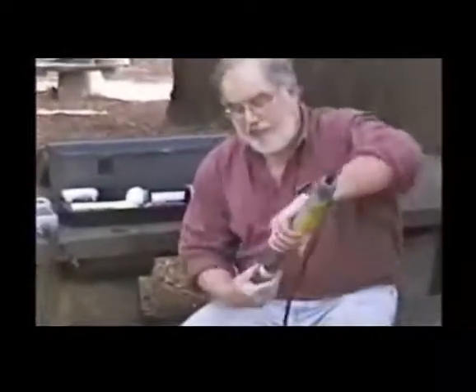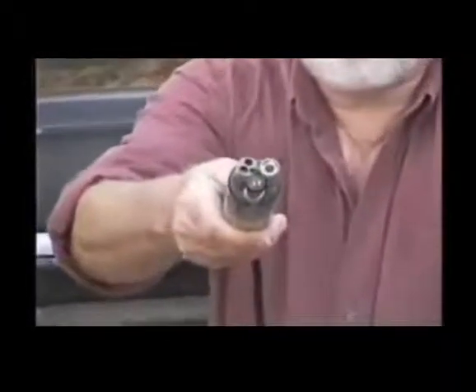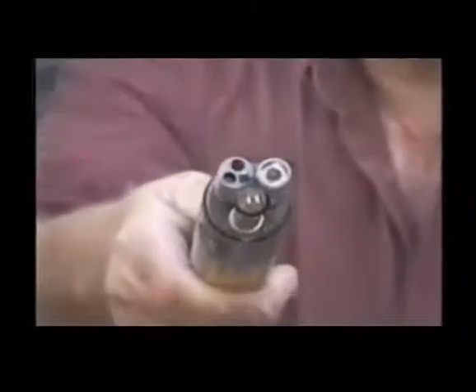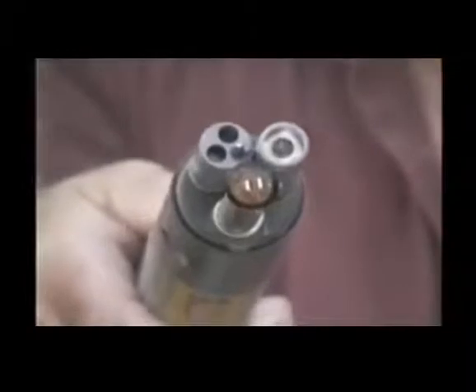So first thing we do is we remove the probe cup, and you'll note this particular instrument has a dissolved oxygen membrane already installed. I'll remove it, but I want you to take a look and see the condition of those electrodes. They're very shiny, the membrane is smooth, and there's no wrinkles, there's no bubbles. The membrane is very closely cut to the side of the instrument, so there's no waste or extra membrane hanging out on the side. So I'll remove the membrane now.